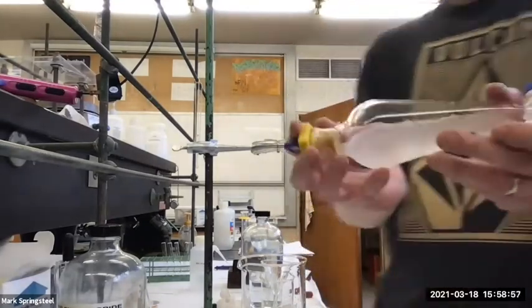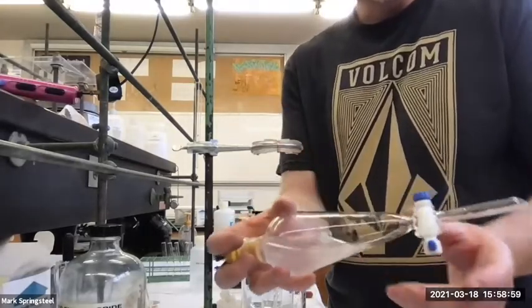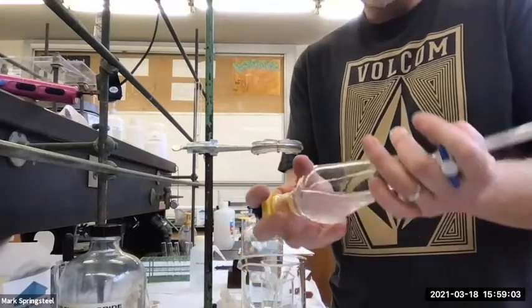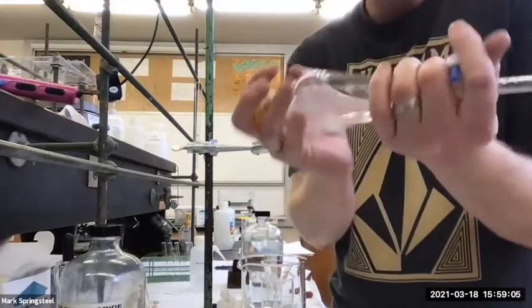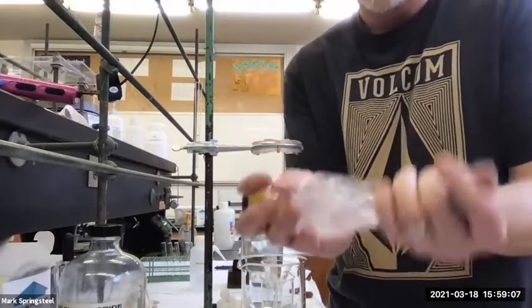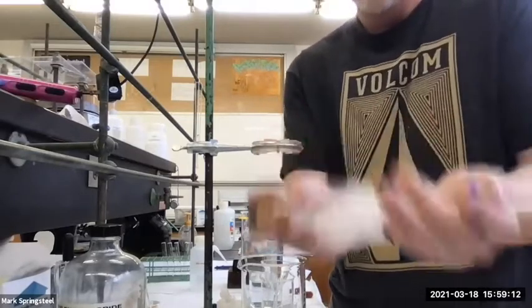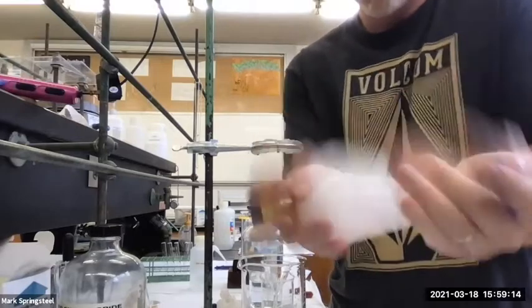I shouldn't make this joke, but I could do Wei Che's joke. When I was in grad school, one of my lab mates, Wei Che, was a brilliant organic chemist from Taiwan. And he would say, yeah, you have to hold it really good and secure like a baby and then shake it. I was like, Wei Che, no, don't shake. He was joking. You don't shake babies, but you shake your separator.